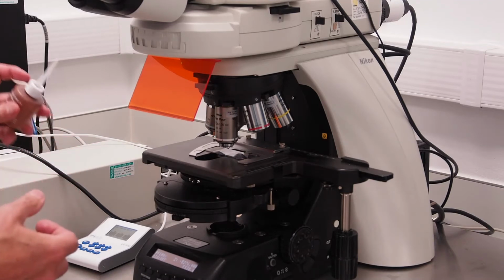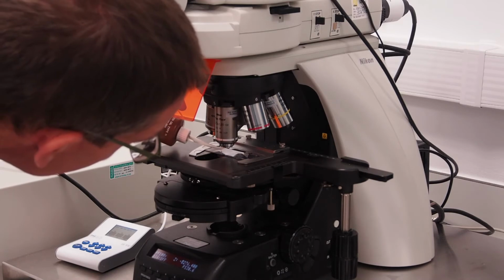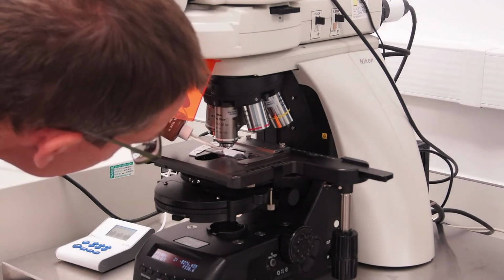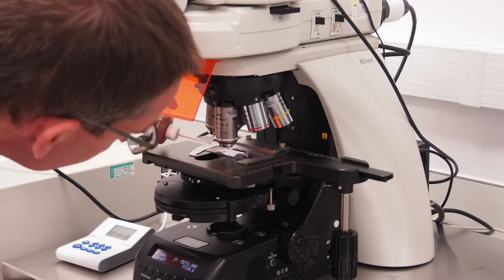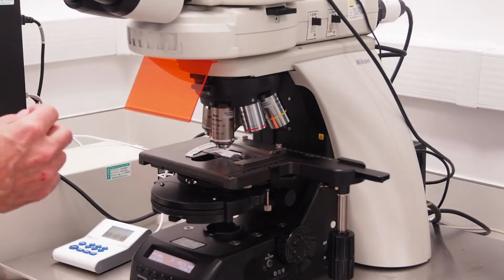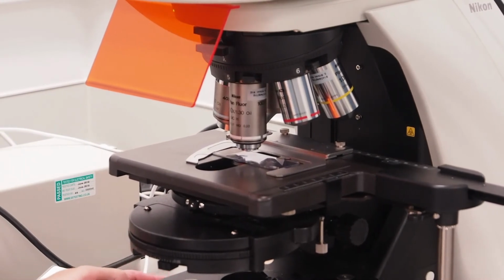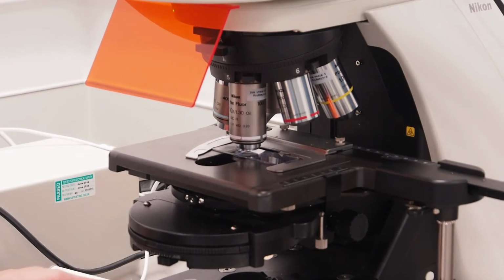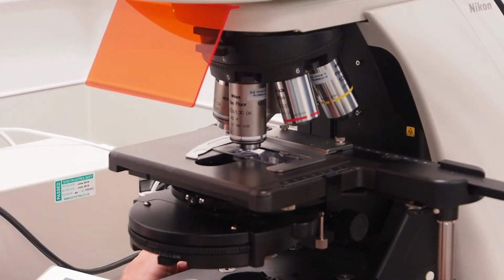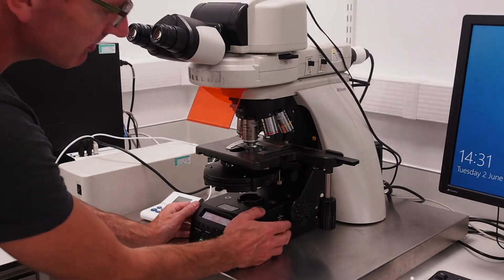Now add a small drop of immersion oil directly below the objective using the supplied dropper bottle. Don't forget to replace the cap on the oil bottle. Return the stage to the focal plane by pressing the Escape button on the left of the microscope once more. Using either fluorescence or bright field, fine-tune the focus and field of view using the stage and focus controls. Once found, switch off the lamps to protect your sample.